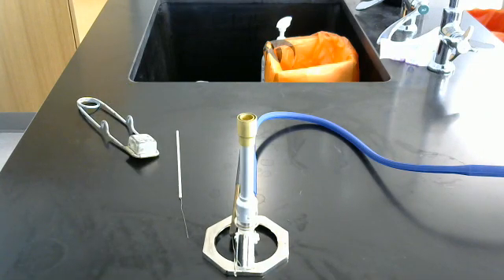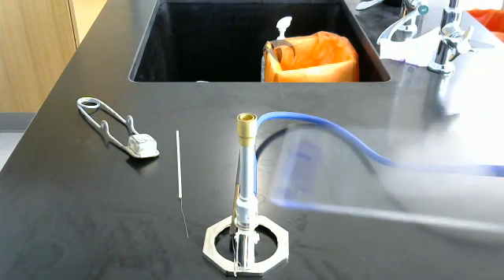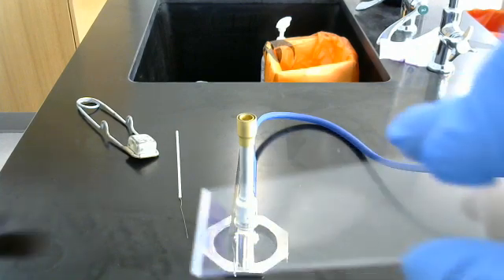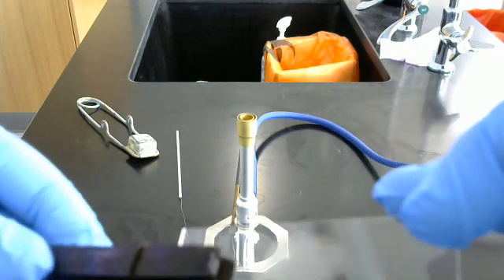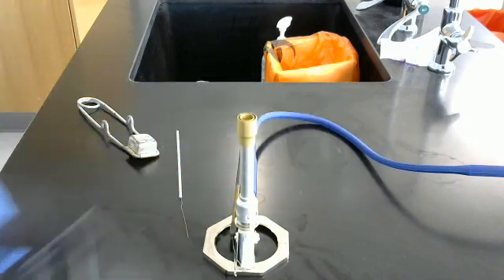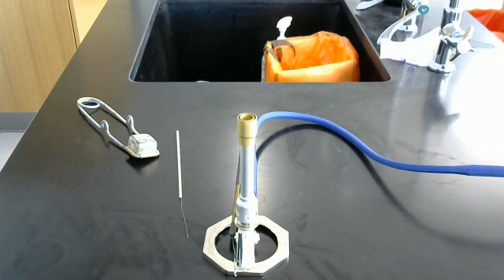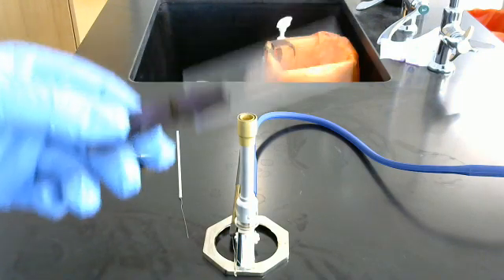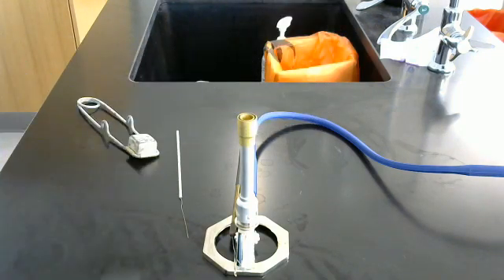And what we're going to want to do as we take our bacteria slide here, I'll show you the side, just right like that. We do this for a few reasons. The first reason being we don't want to get burned. The second reason being that we are going to be staining this. And that's going to be right after this. I'm going to do a bit of staining.